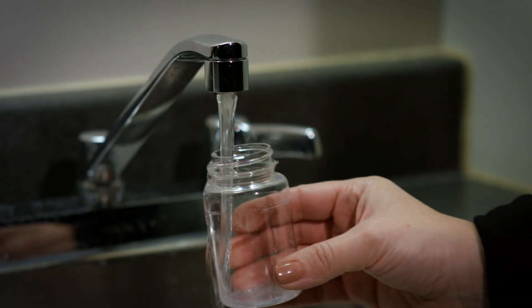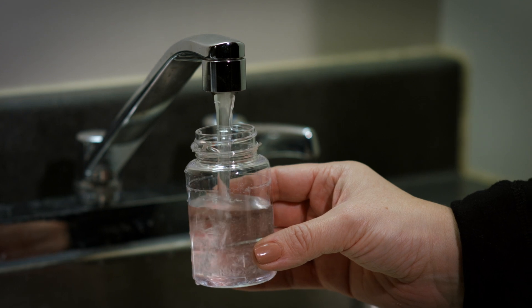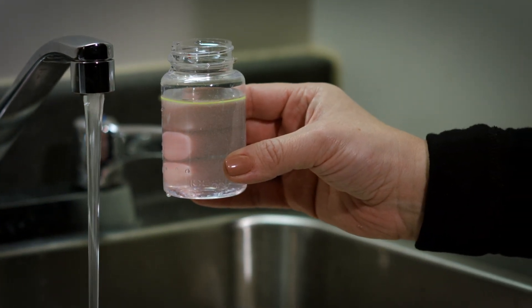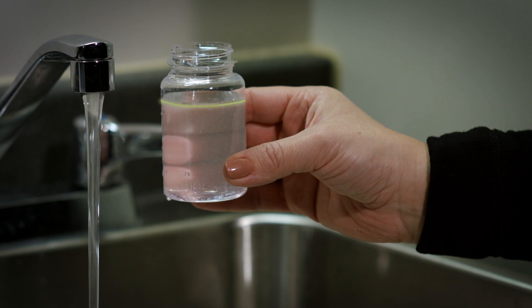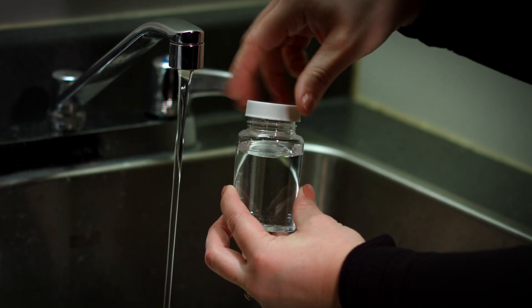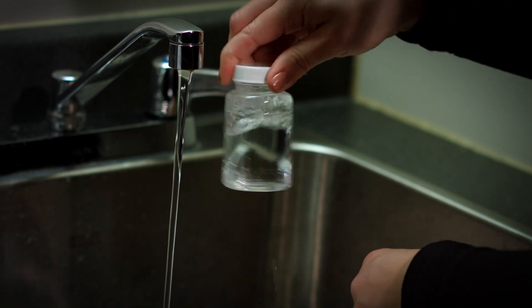In addition, do not allow the screw cap or mouth of the bottle to come into contact with any surfaces that may introduce contamination. Holding the sample bottle near the base, fill the bottle to the indicated 100 milliliter mark on the bottle. Do not overfill or underfill the bottle. Bottles that are filled above the fill line or below the fill line will be rejected for analysis. Immediately replace the cap and ensure that it is on securely. Shake the bottle.